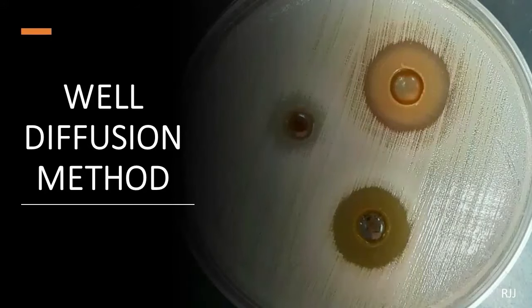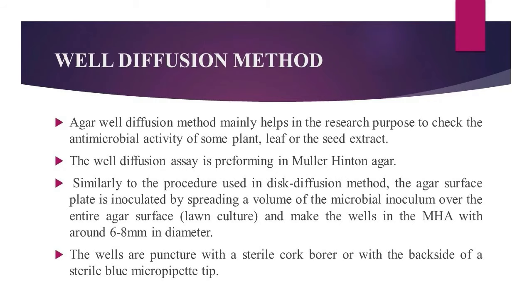Hi, in this video I will demonstrate the well diffusion method. The agar well diffusion method mainly helps in research to check the antimicrobial activity of plant leaf or seed extracts. The well diffusion assay is performed in Muller Hinton agar.